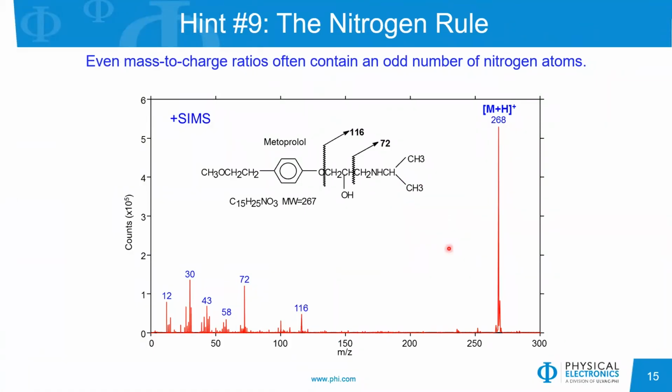Also in TOF-SIMS, many of the typical rules for interpretation of mass spectra still apply. So probably the biggest one is the nitrogen rule. What the nitrogen rule says is that if you have a peak in the positive ion polarity that shows up at an even mass, then it is quite typical that that ion will contain an odd number of nitrogen atoms. So here we're looking at a peak at a mass to charge ratio of 268. It is the M plus H ion, and it is bearing one nitrogen atom in the molecular structure.